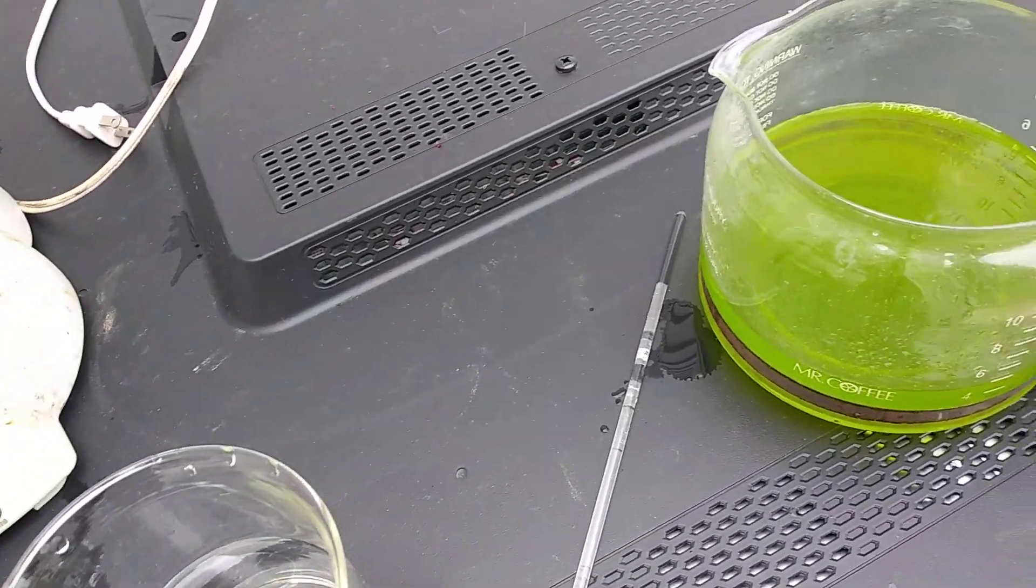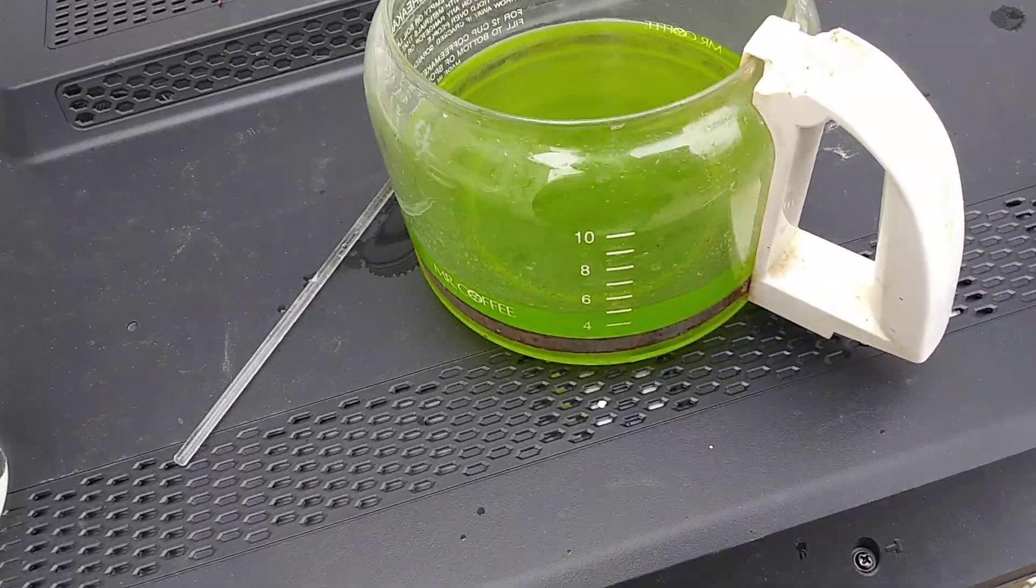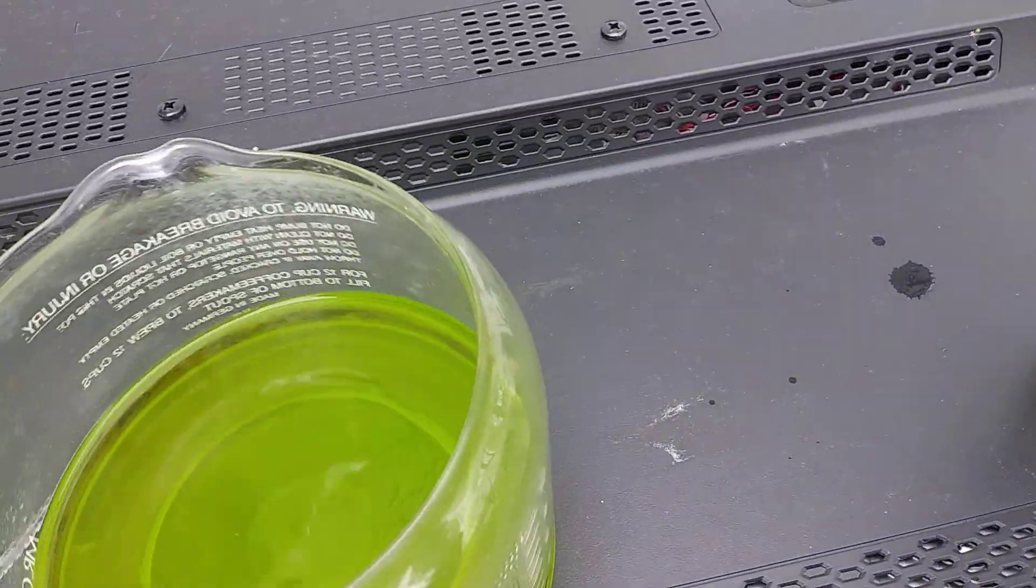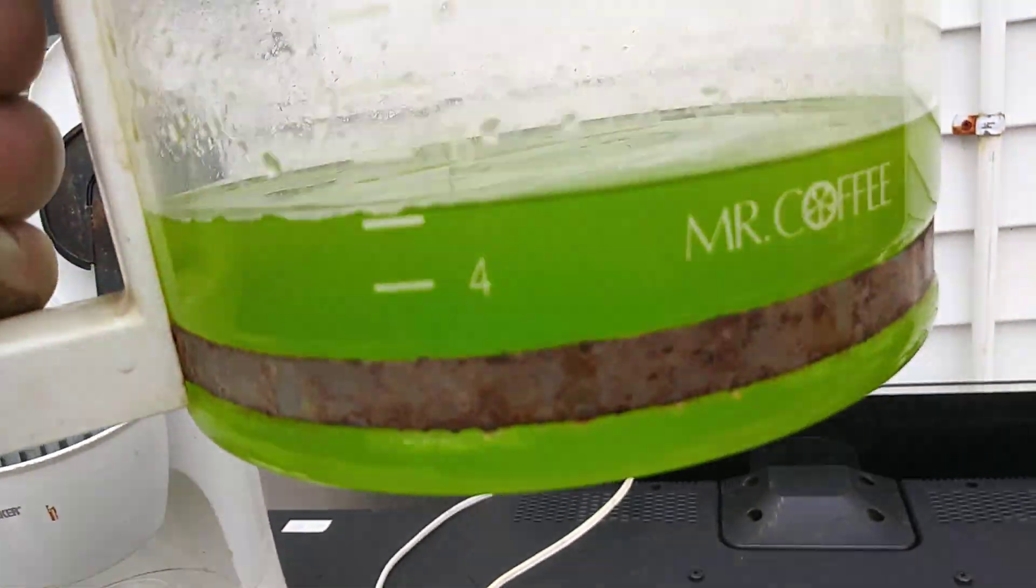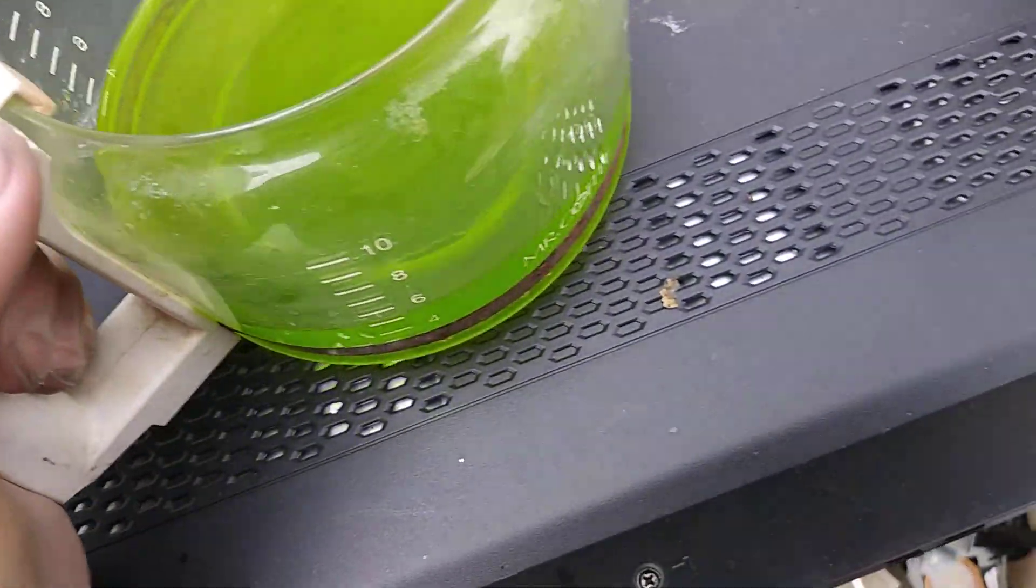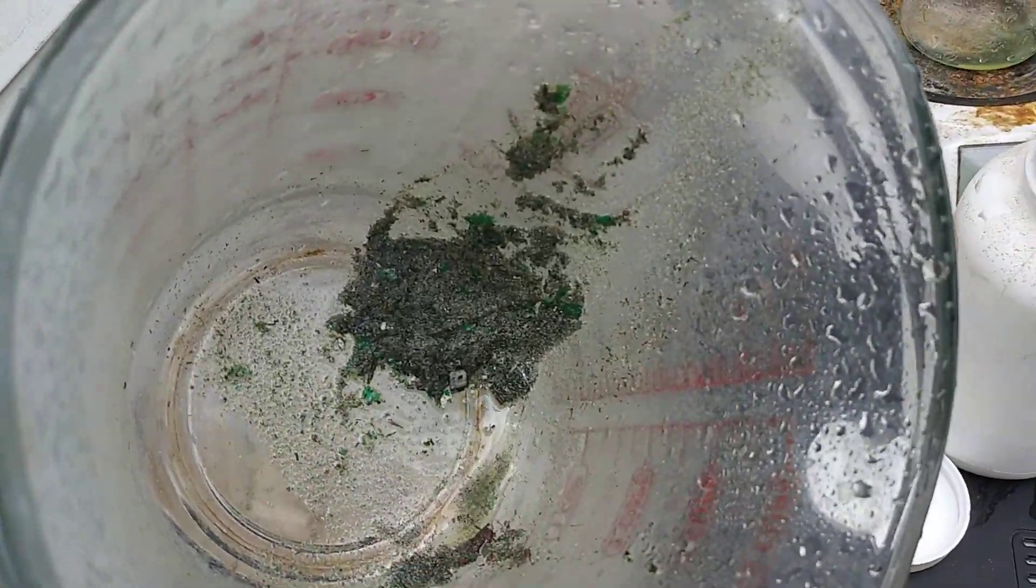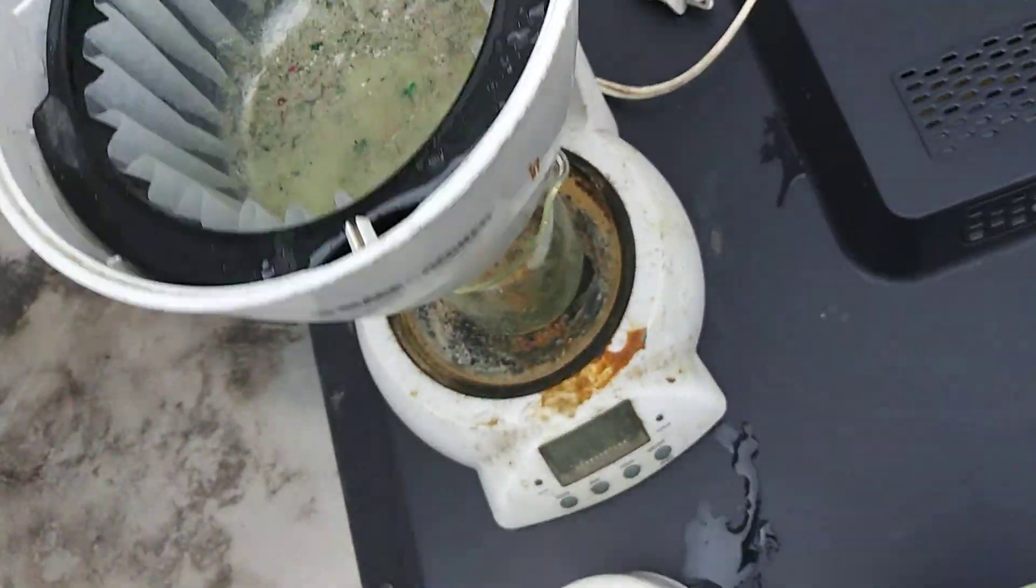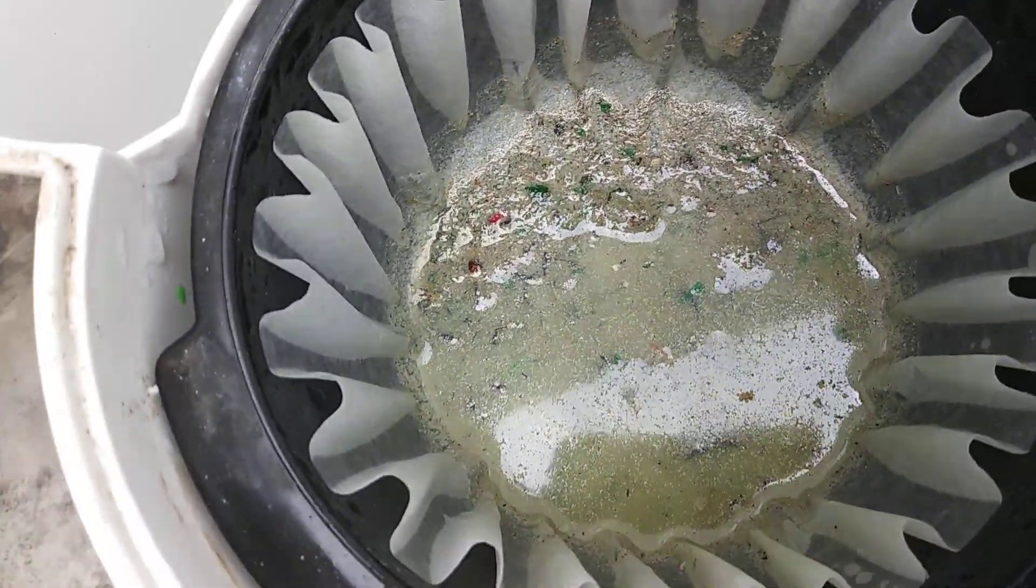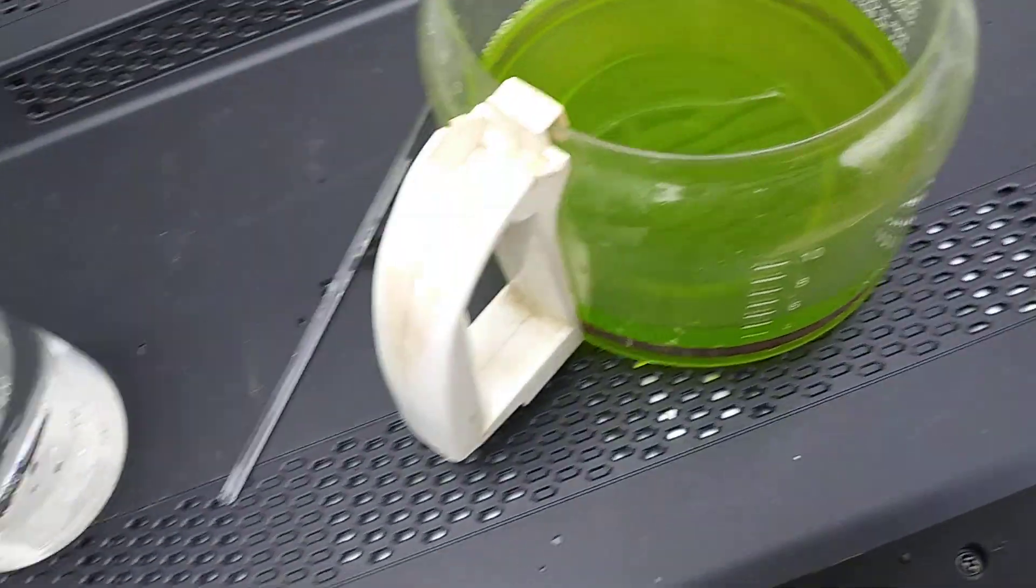Alright, part three. Putting the SMB in there to bring this solution and turn it back into gold. You see there's no debris in there. That's the debris that was left in there, there's quite a bit. And that's the debris that was left in the filter, which is quite a bit.